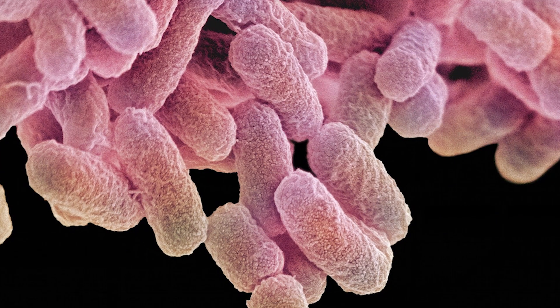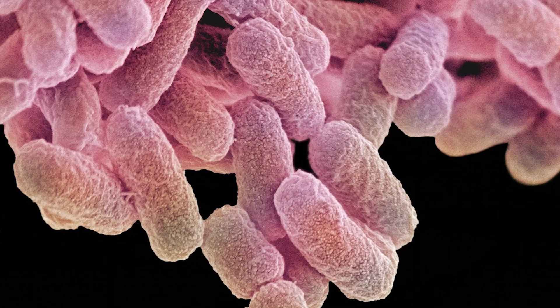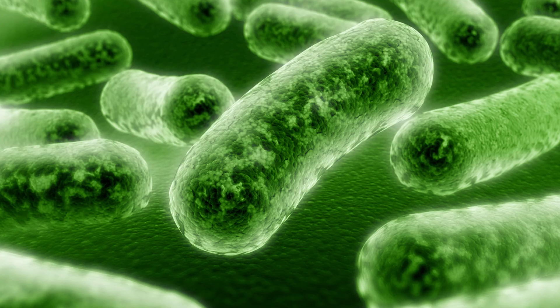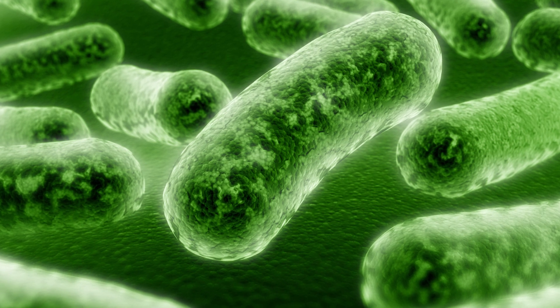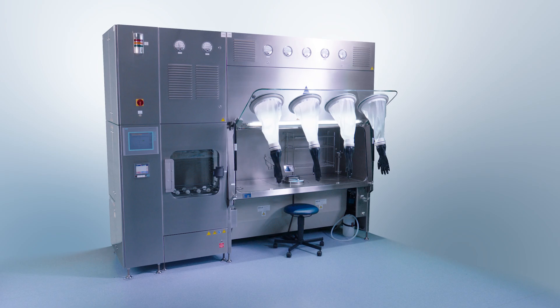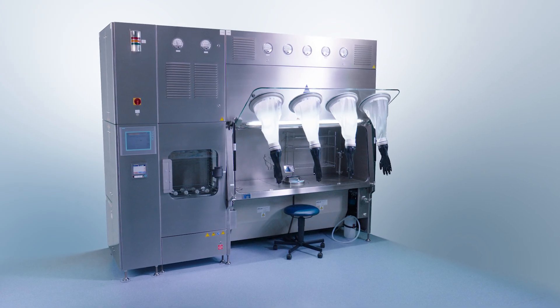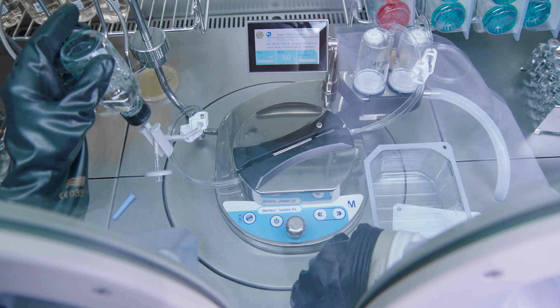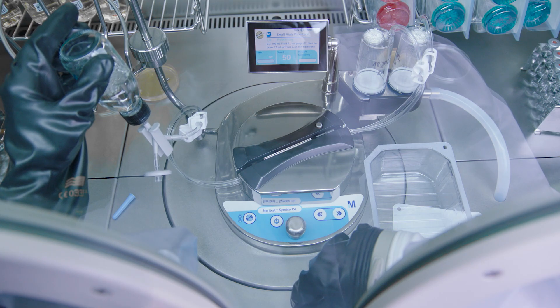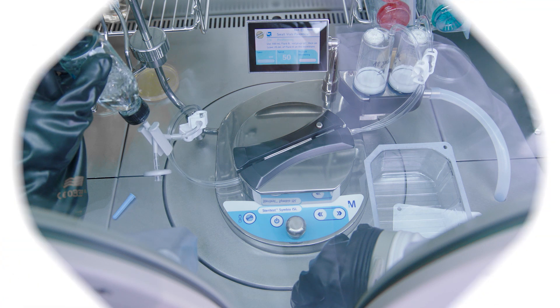Sterility testing is one of the most critical controls before the release of sterile drug products. Deviations always lead to extensive investigation and product waste. Partnering with the right suppliers helps to ensure the security and reliability of your sterility test results.